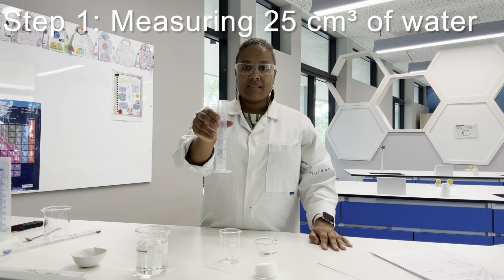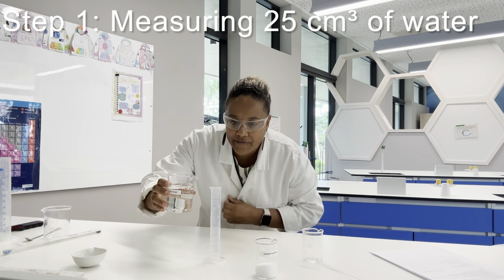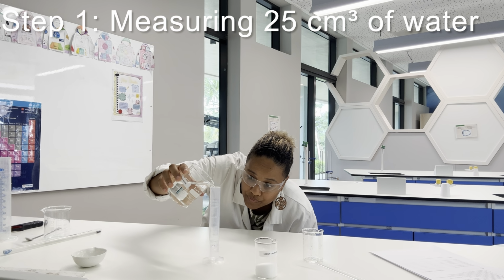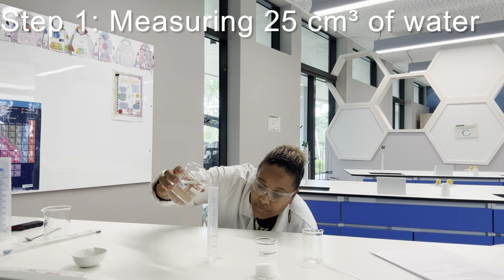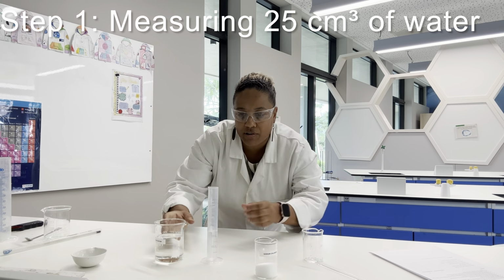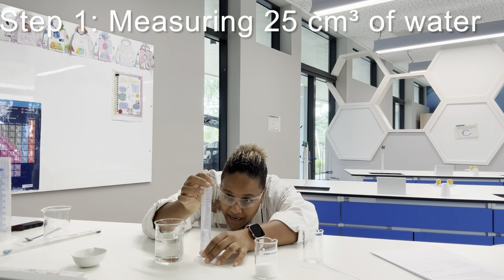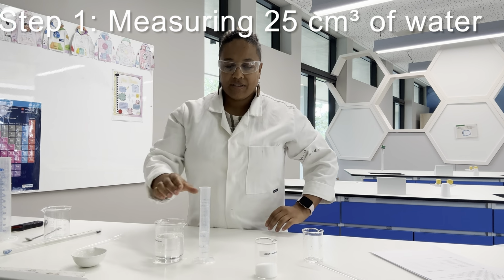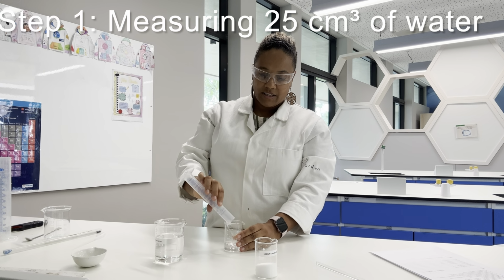So we've got a measuring cylinder, and I'm going to pour 25 centimetre cubed into my measuring cylinder, making sure that the bottom of the meniscus is on 25. I've gone over a little bit, so I'm going to use this Pasteur pipette to just take a little bit out, making sure that the bottom of the meniscus is touching 25. So that's my 25 centimetre cubed, or 25 grams of water. I'm just going to place it into a beaker.